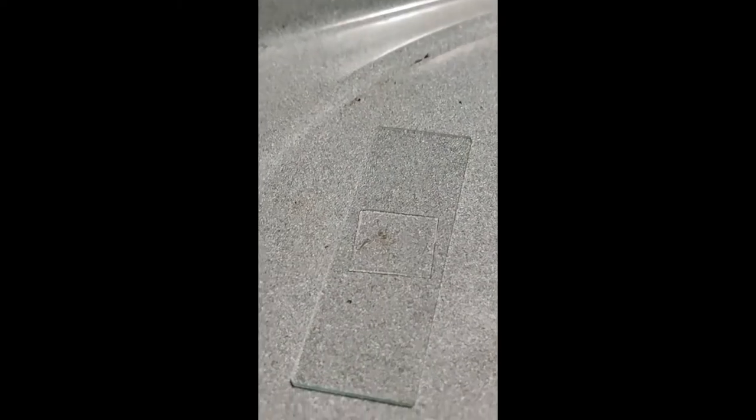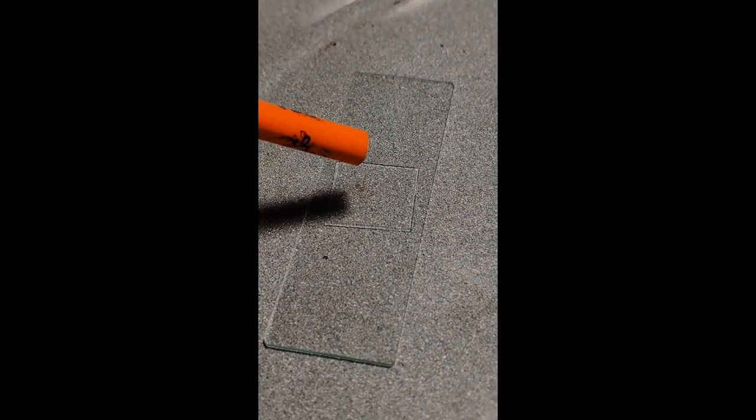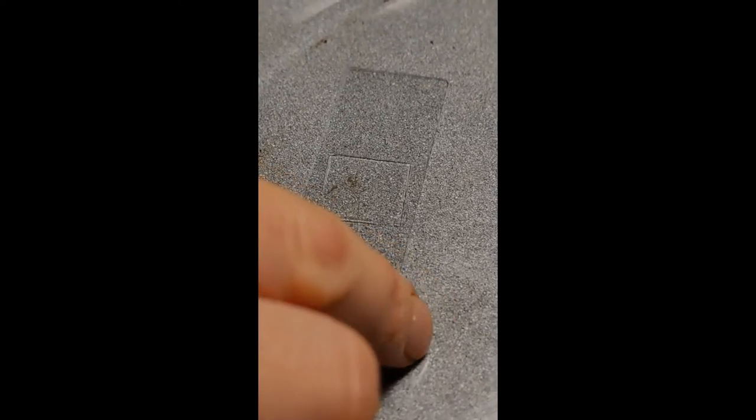And if there was more material on this, like a bit of mushroom flesh, I might squash it a little bit by using the end of the pencil, not my finger so I don't get my finger grease on it.